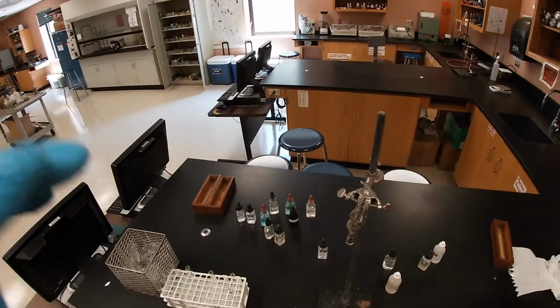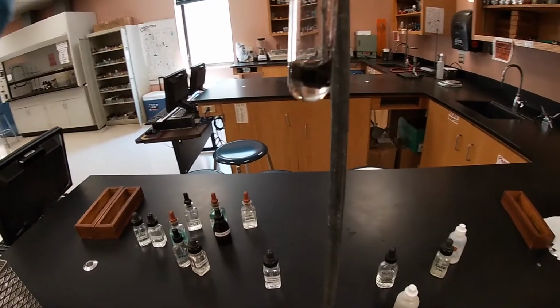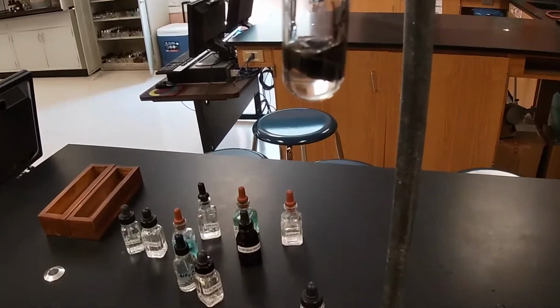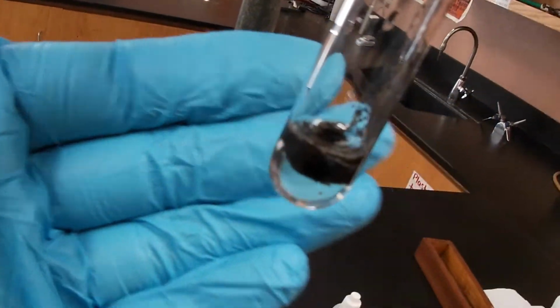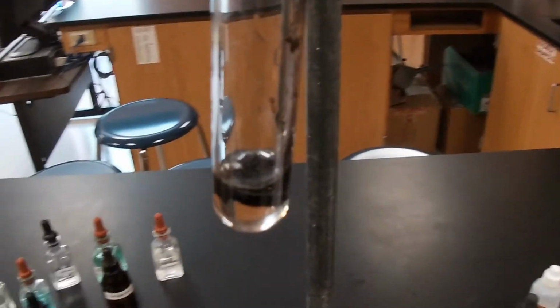And so here, as you can see, you do have a nice little precipitate. Not our usual precipitate that we normally have been seeing. But here you can see that there is like a black blob that is formed. And your job is to determine what that black blob is. Beautiful, look at that. And so that is the reaction between lead nitrate and sodium sulfide. Your precipitate in this case will be black.